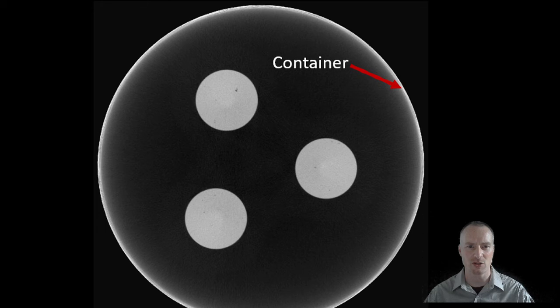Sample setup in X-ray computed tomography is very important. In this case, we have 3 specimens set up at the centre of rotation for the CT scan. They are also placed in the centre of the container, which is acting as an X-ray filter. This ensures that we have a uniform profile across the specimen for the matrix phase. If the specimens are placed too close to the X-ray filter, then we will have a non-uniform grayscale profile going across the specimen. This is shown in this slide.